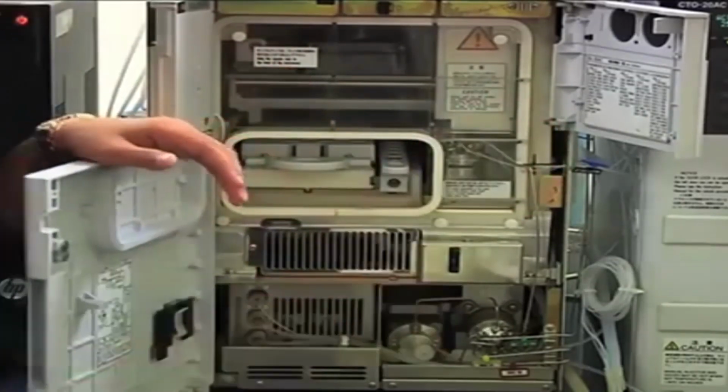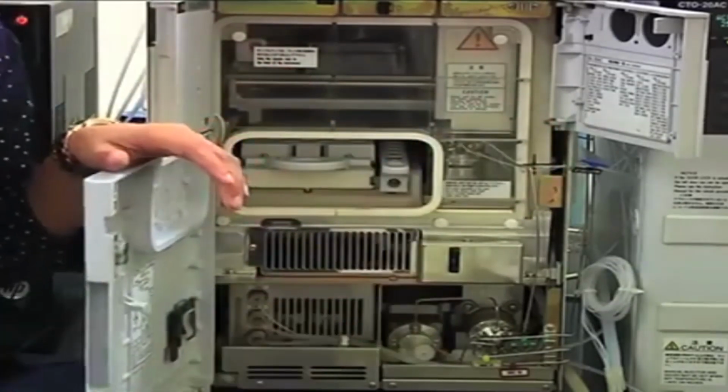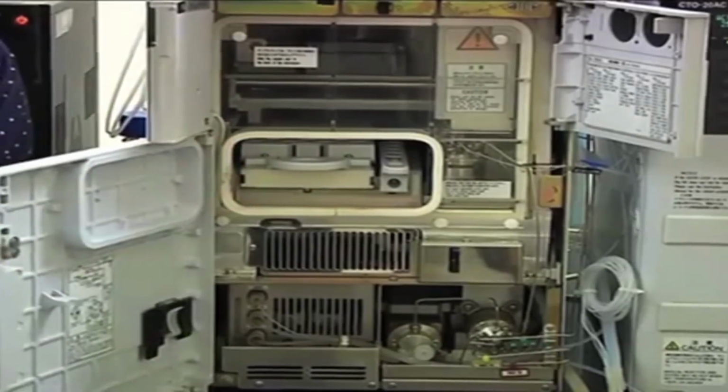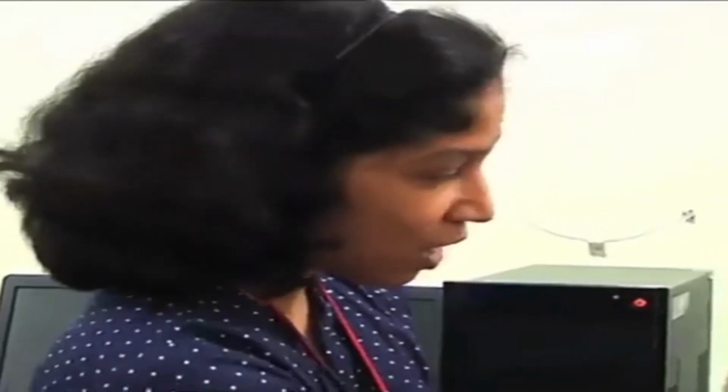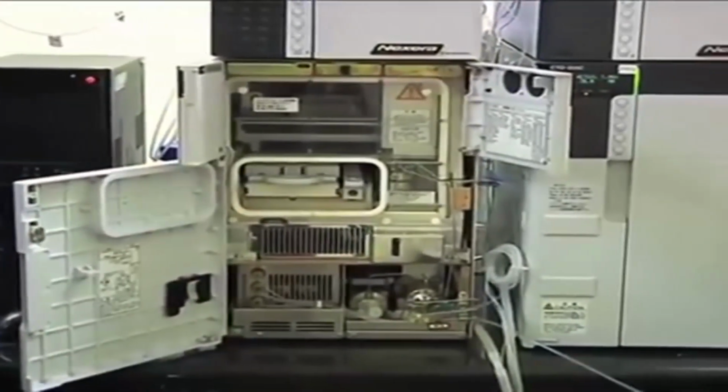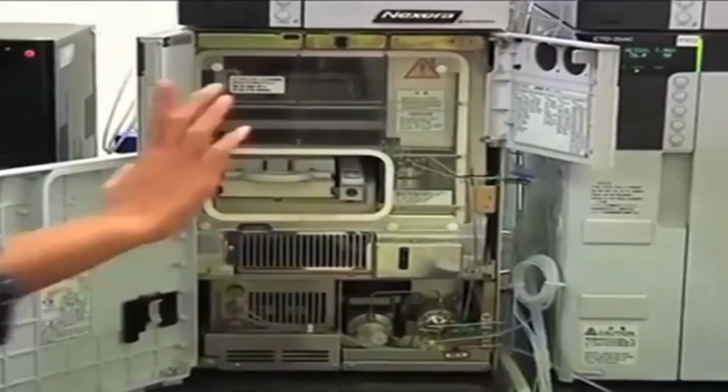Now what is the function of the low pressure valve? Suppose you have a manual injector. When you inject 2 different samples, in between the samples you perform rinsing of the needle or rinsing of the syringe, so that there will not be cross-contamination, right? So when you are using an auto sampler, that function also needs to be done automatically, and that is the purpose of this low pressure valve. So in between the analyses, whatever rinsing happens, that happens because of the low pressure valve.